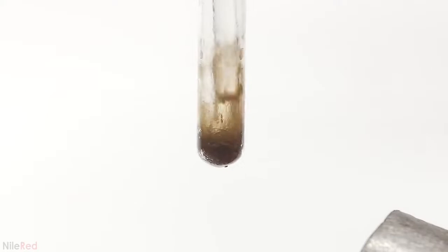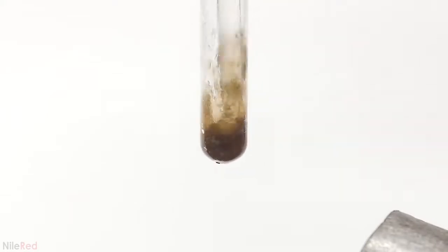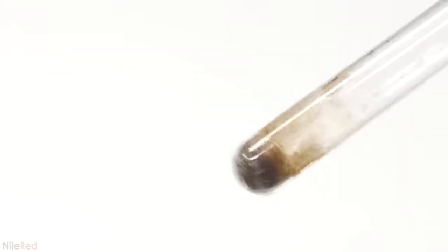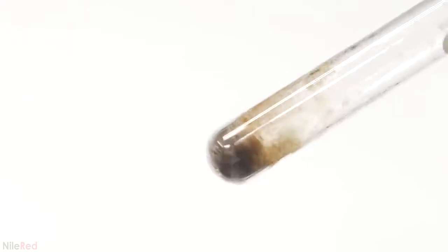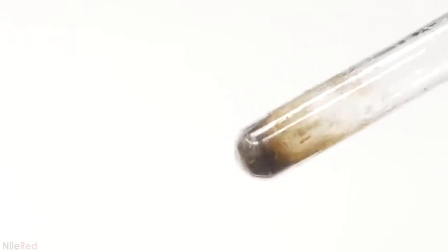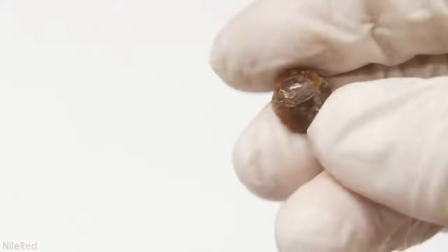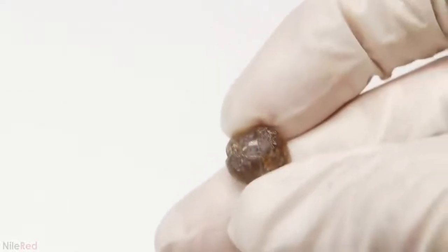After a couple minutes, it was a gooey blob at the bottom, and I think it's a mixture of liquefied diacetate and semi-solid triacetate. I let it cool down, and then I smashed the tube with a hammer and recovered the small piece of plastic. Although it turned brown, probably because I heated things up a bit too much, I was still pretty impressed with it. I was curious to see how durable it was, so I got my hammer.